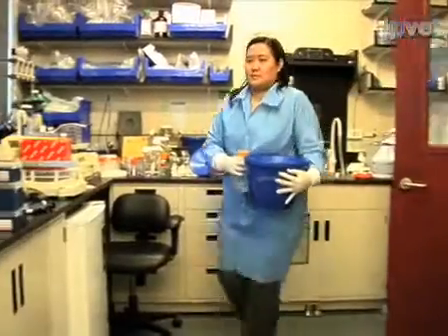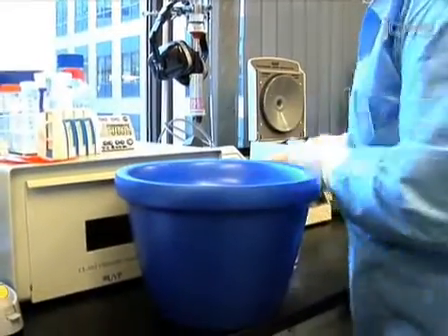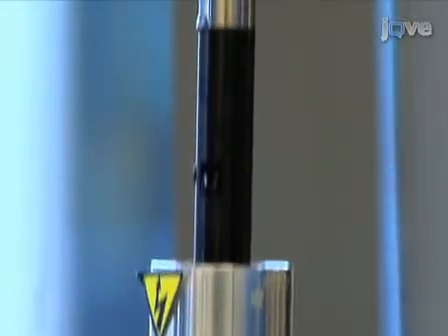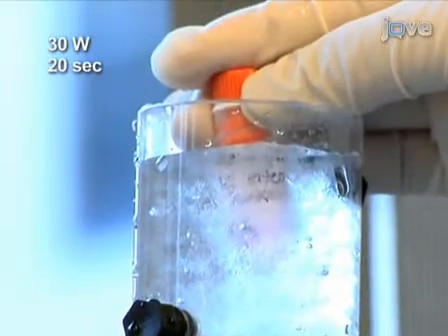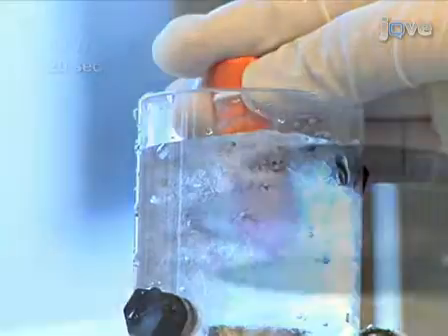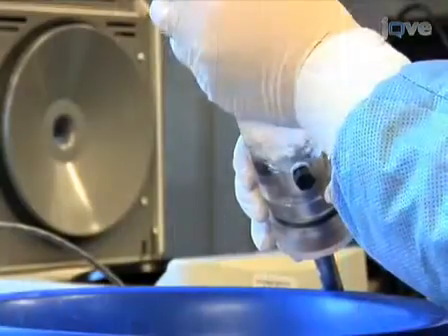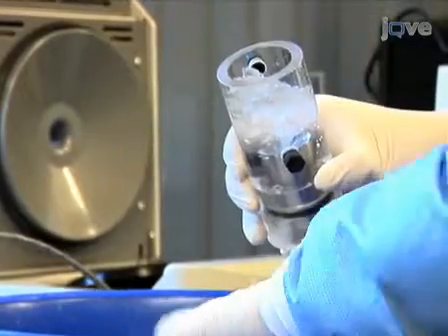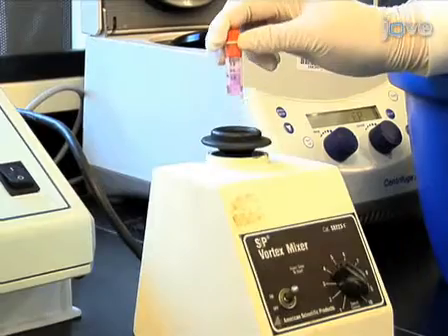If you are using a crude Vaccinia virus stock, sonicate an aliquot of the virus just before infection in a cup sonicator with a bath of mostly ice and a little water. Sonicate it around 30 W for 20 seconds. Vortex the tube and repeat the sonication 3 times, adding more ice if needed to keep the cup packed with ice and chilled. Be sure to vortex in between each sonication step.